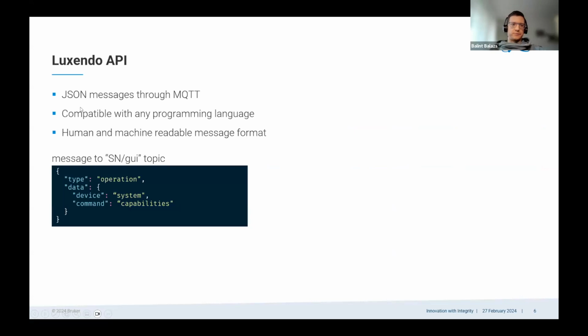Just an example of how it looks in practice. So we use JSON messages. We send these through MQTT, and we like this format because it's easy to read, easy to write, and easy to parse by machines as well. So for example, when the user interface starts, it will publish a message to this topic. SN is the serial number for the microscope / GUI. And it will just say that it wants the system capabilities.